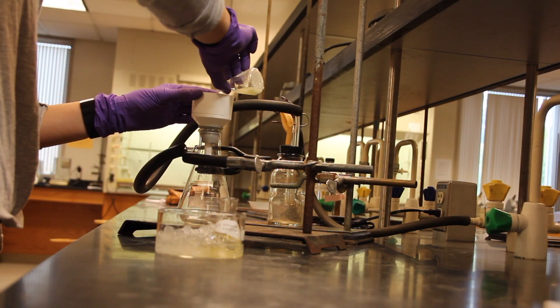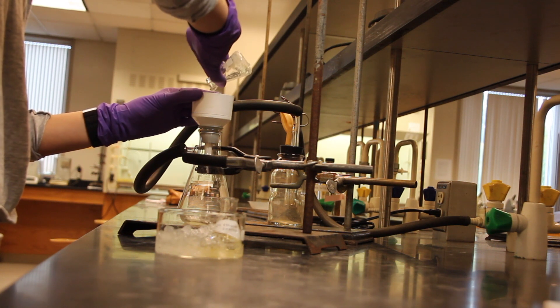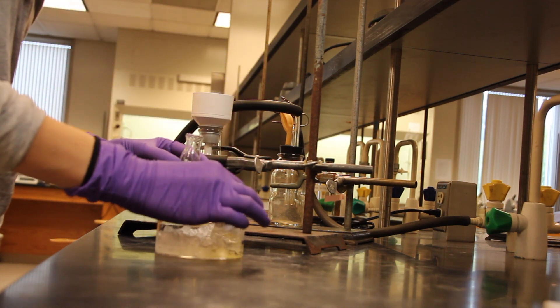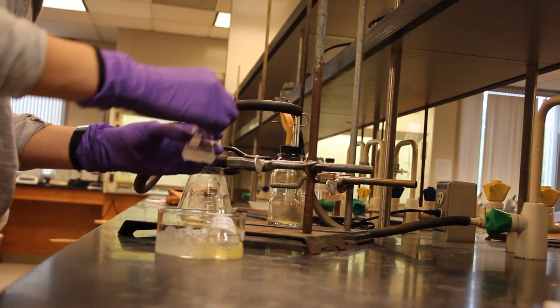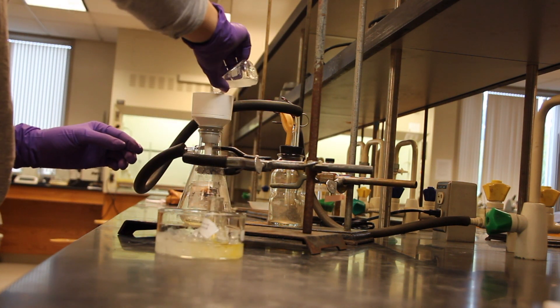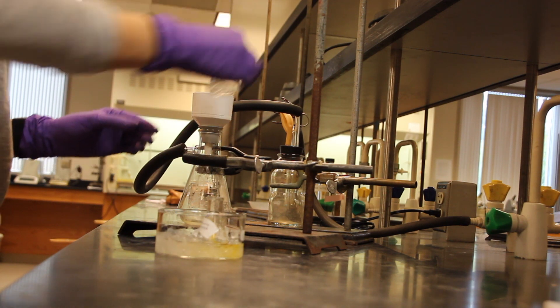Use suction filtration to isolate the solid product and rinse your crystals with ice cold 2 to 1 ethanol water. In order to minimize product loss while rinsing, the solvent for rinsing the crystal should always be the same solvent that was used during the recrystallization but ice cold.